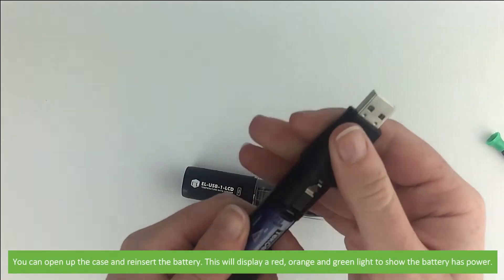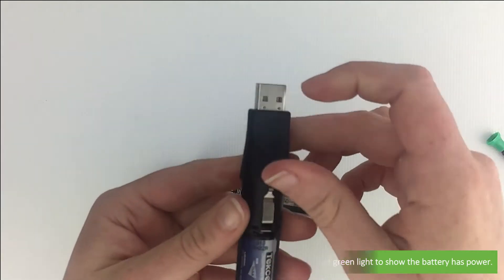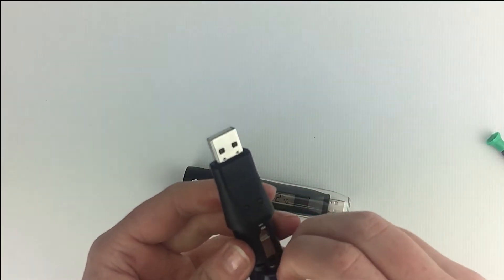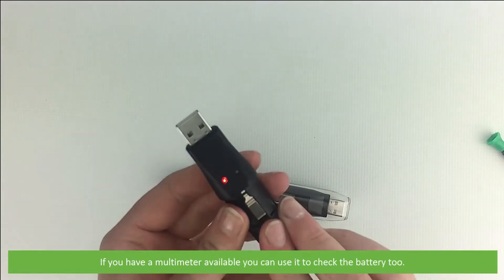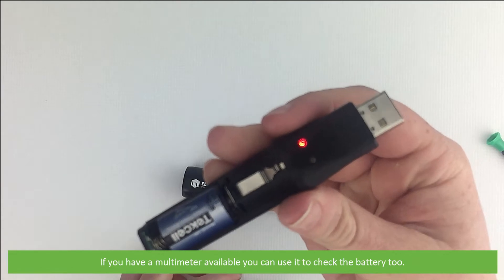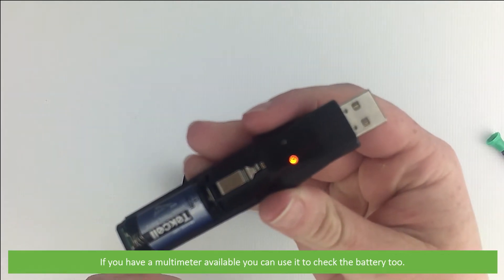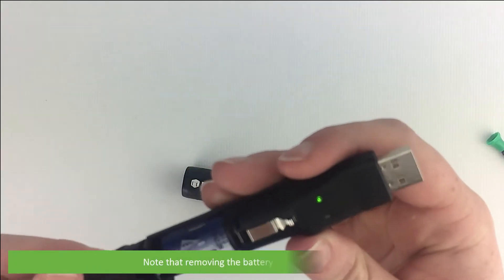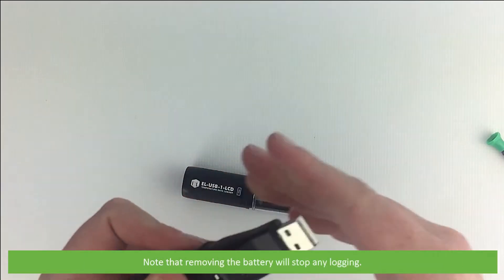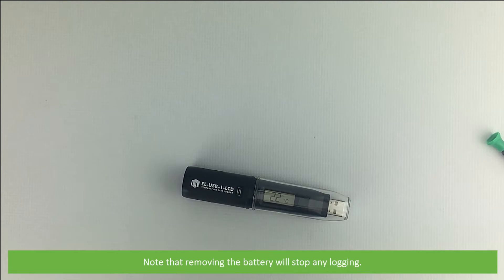Reinserting the battery will display a red, orange, then green light to show that the battery has power. If you do happen to have a multimeter available, you can always use that to check the battery too. Note that removing the battery will stop any logging.